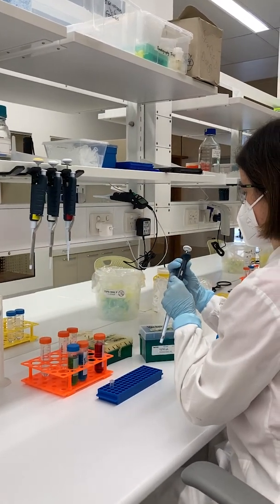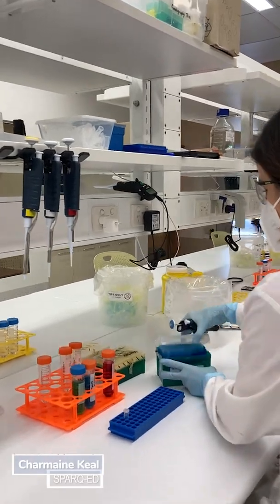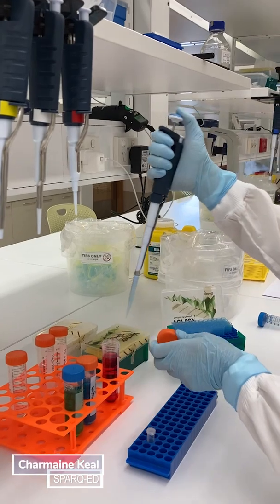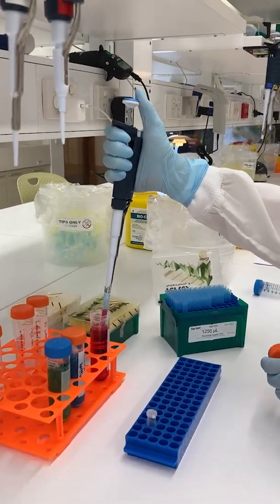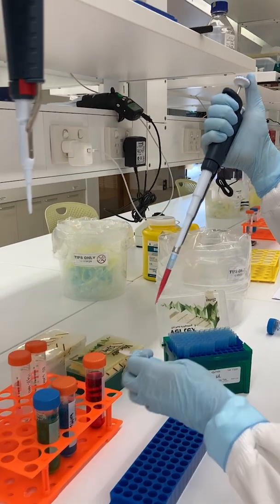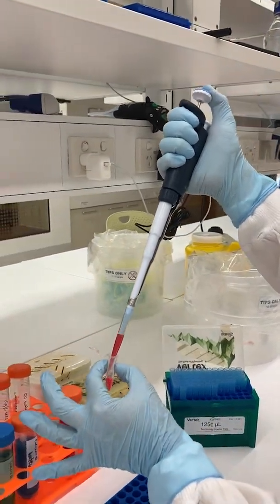Pipettes are used in the laboratory to measure and dispense small volumes of liquids accurately. This video provides a brief introduction in the use of micropipettes, as well as some tips and tricks to watch out for when using them.